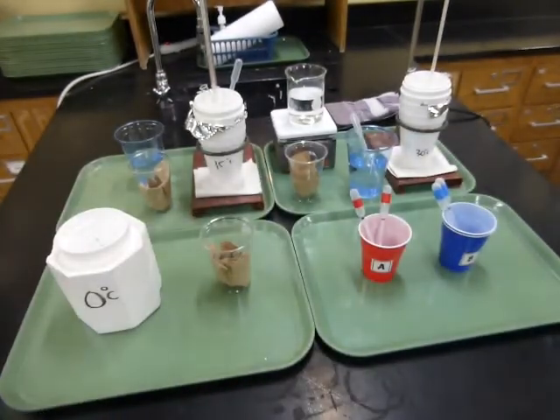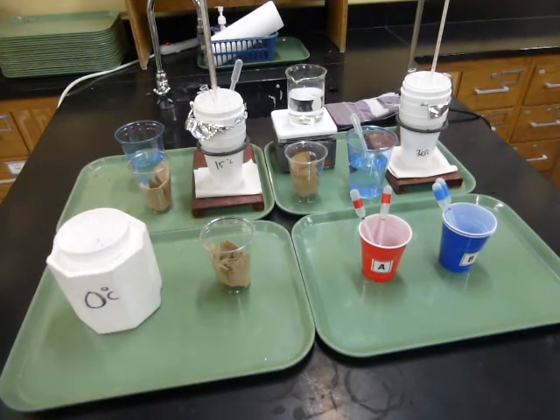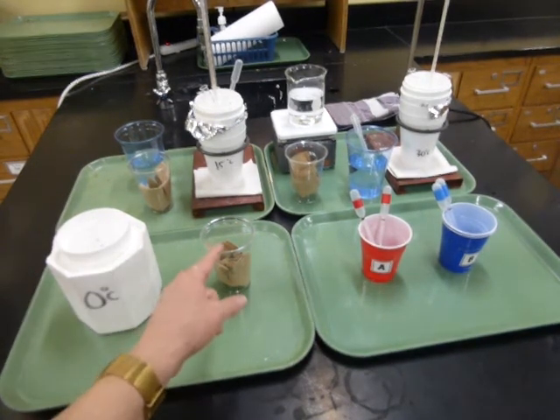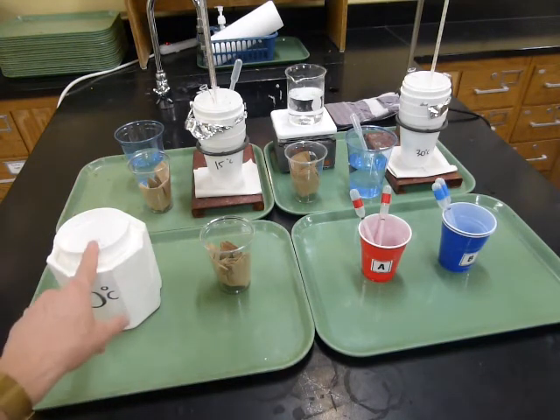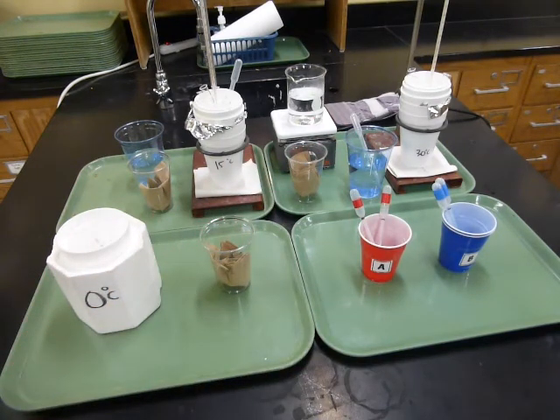And again, when you're all done, test tubes get poured into the sink, rinsed out, and then put back in the cups where they came from. You can dump and toss the little white cups, but please do not dump out the water baths. I'll take care of those for you.